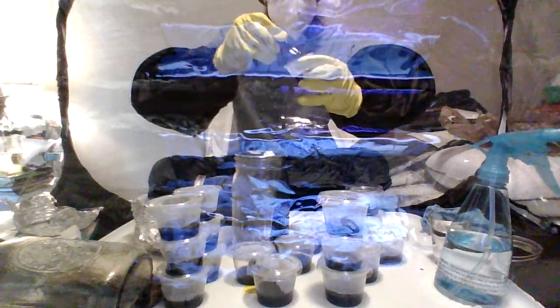All right, so I set this up straight. Now we're basically going to drop this sample all the way to the bottom of it, and I'm going to show you why. Careful not to drop your sample until you're ready. All right, so here goes my sample. Now that's in the bottom of there, right? We have the contaminated sample in the bottom. I'm going to take my tweezers and put them in my shot glass of rubbing alcohol, right?